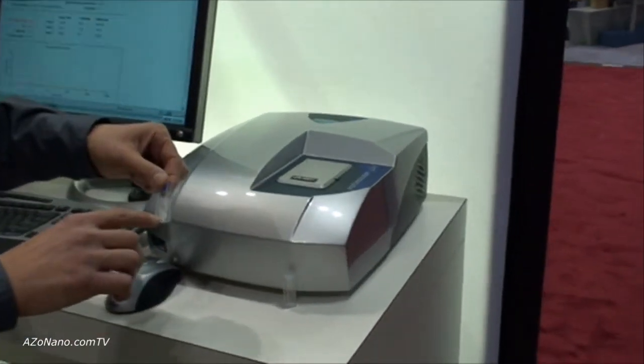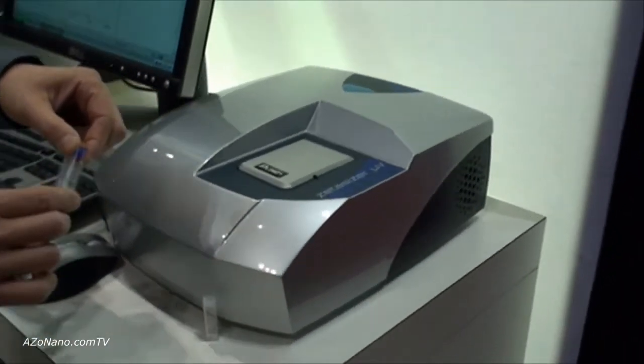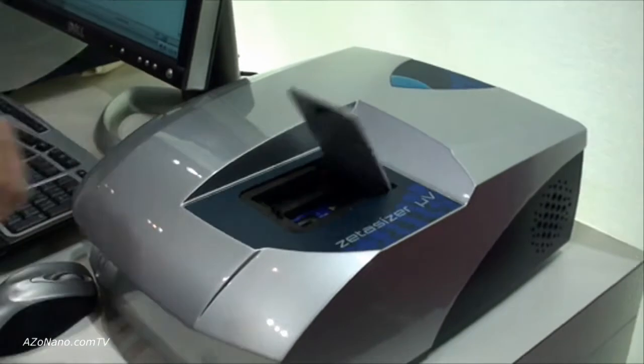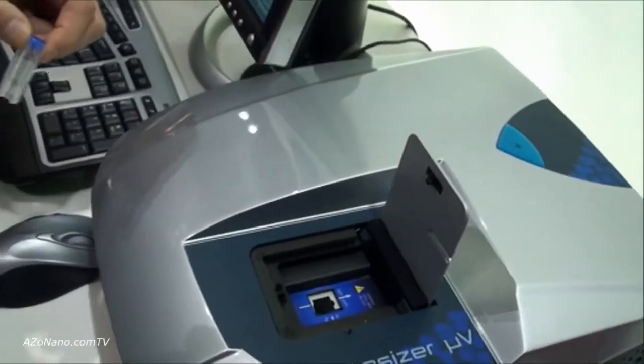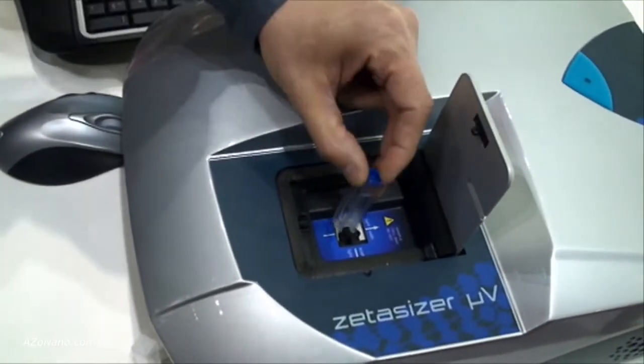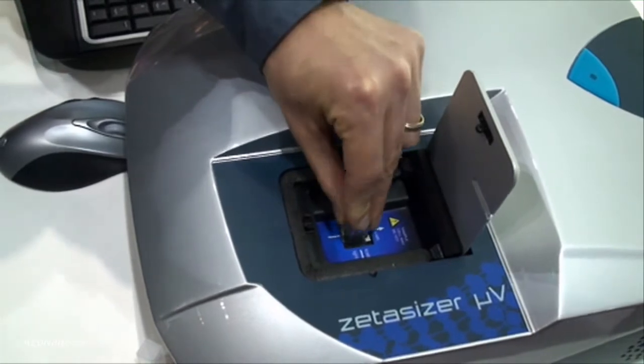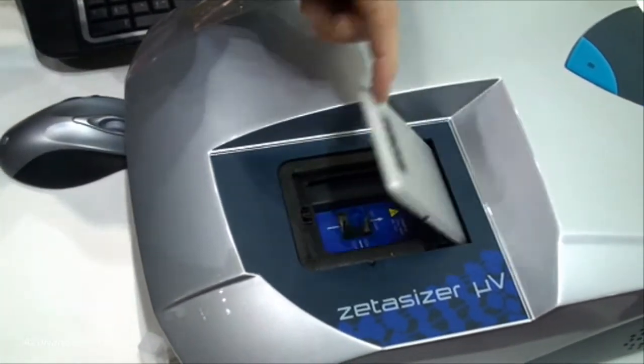Once your sample is loaded in the cuvette, we simply open the lid to access the measurement chamber, place the cuvette in, and close the lid.